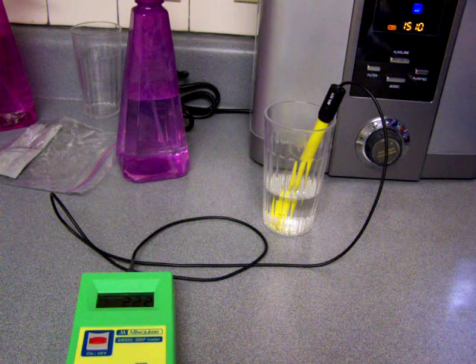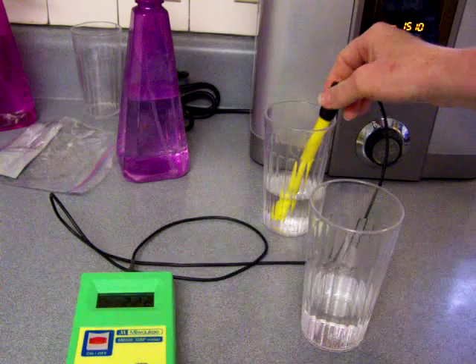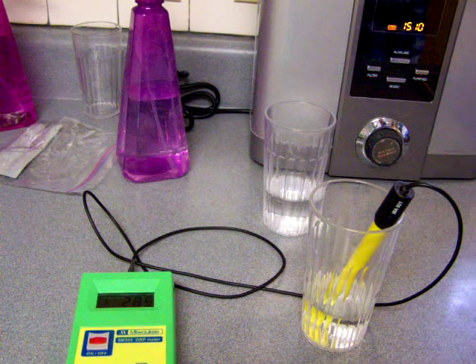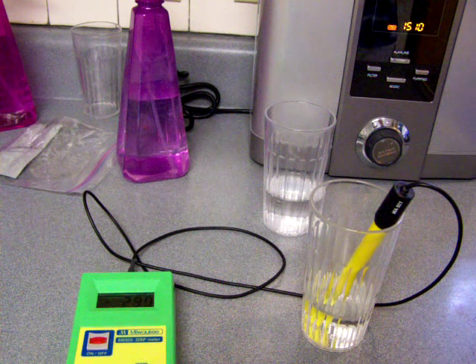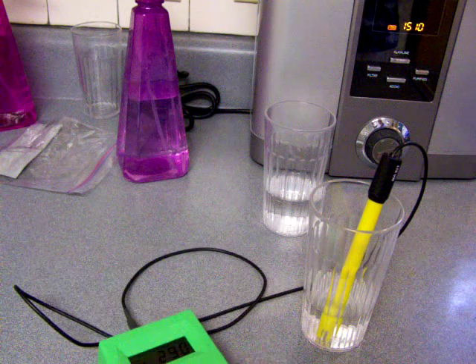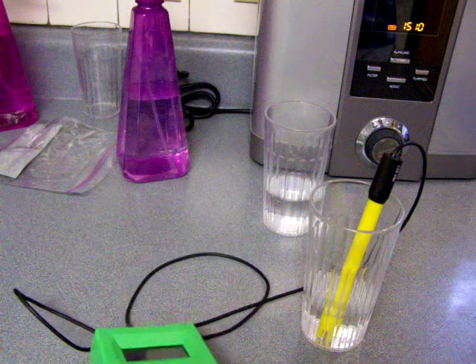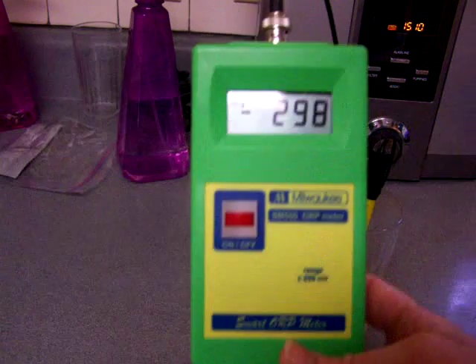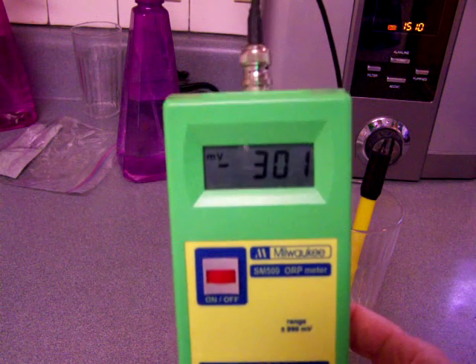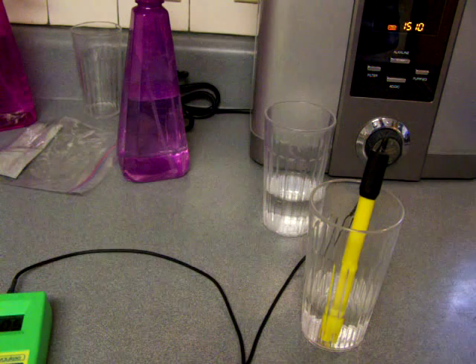Now already, because I know I've tested this water enough times, I know what the ORP is going to be. With a dirty meter, if I put my ORP probe in ionized water from the Athena, the Athena actually self-cleans continuously, so it has a very consistent ORP, and if it's only showing up at -299, then I know that ORP meter is very dirty and needs to be cleaned.